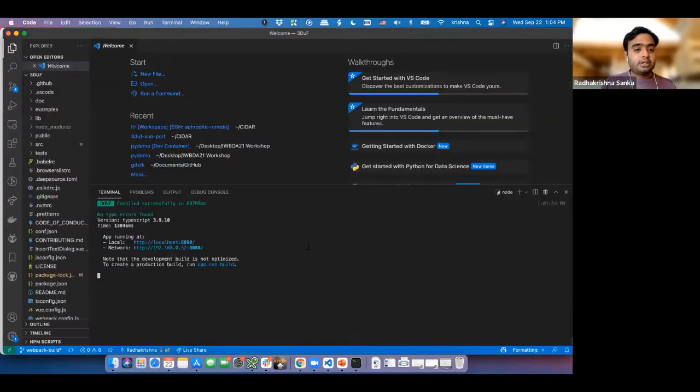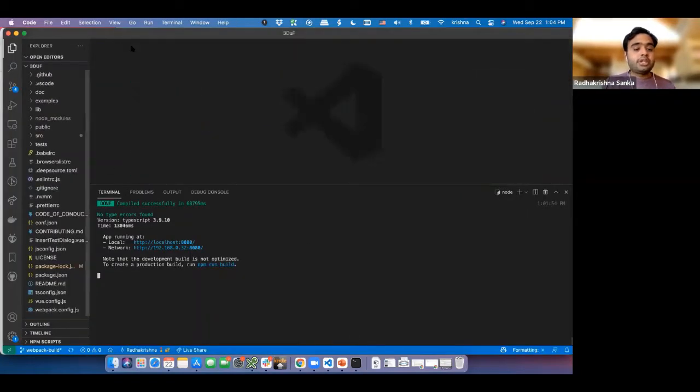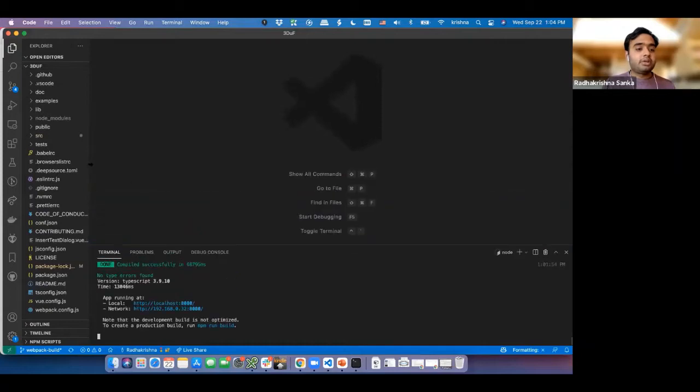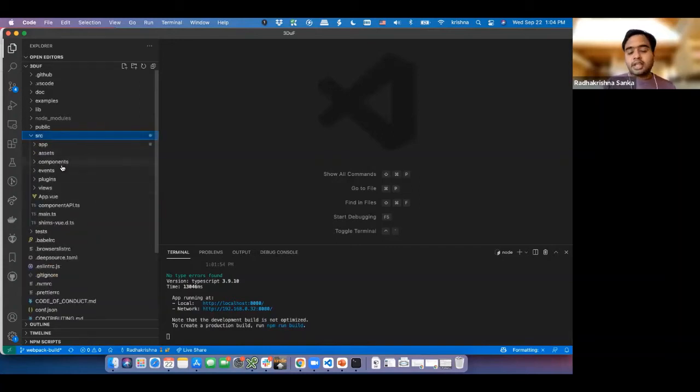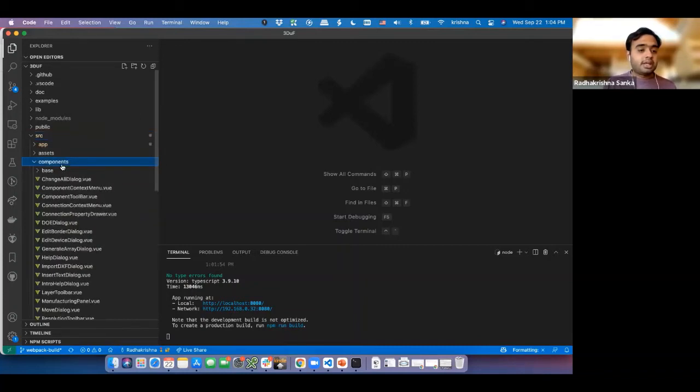So now that this is done, because I need to make a new component, the first thing that we need to understand is how do I go about doing it? The code base which we have is actually very well structured. It's easy to understand. It will take a little while, but once you know how it's arranged, it's very easy to go about it. All the UI components are inside this one.